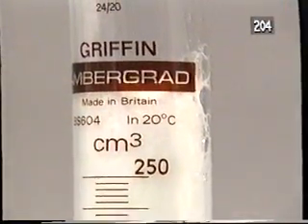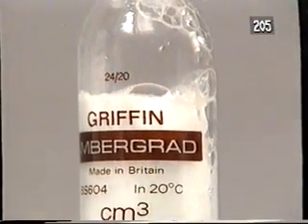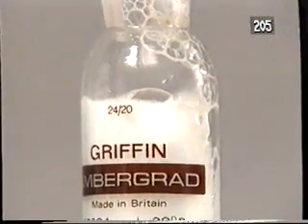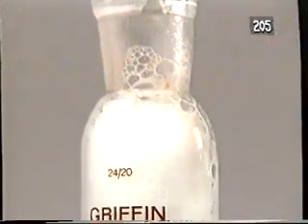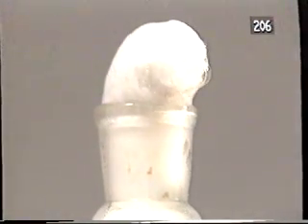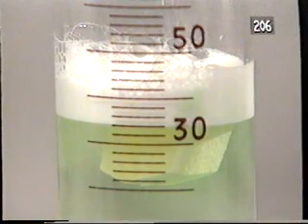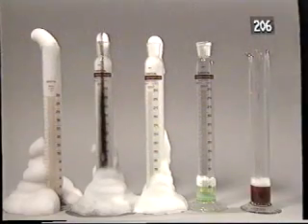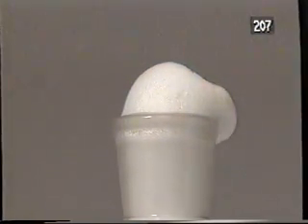The next best catalyst is liver. Gas continues to be produced at a steady pace. The potato produces some gas, but it is a poor catalyst. The foam relights the glowing splint, confirming oxygen is produced.